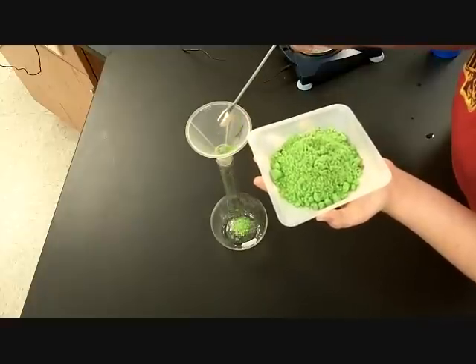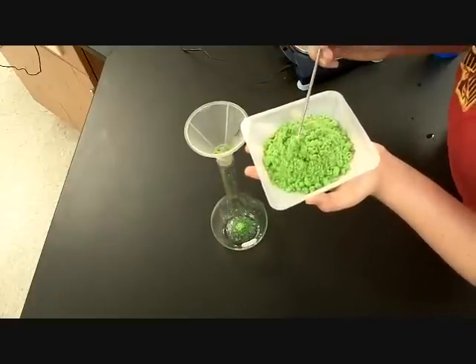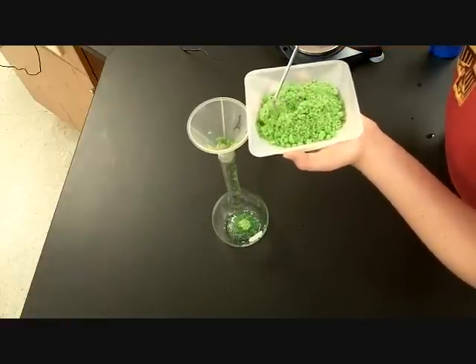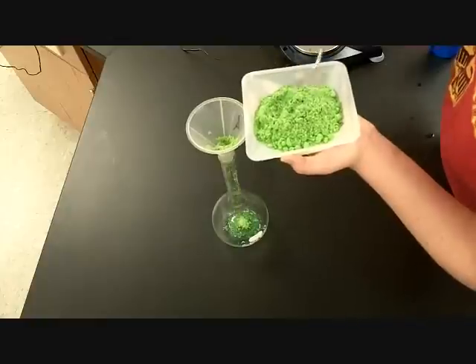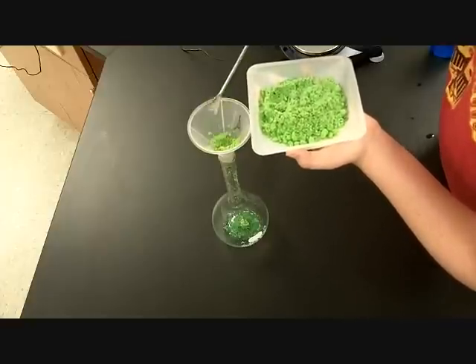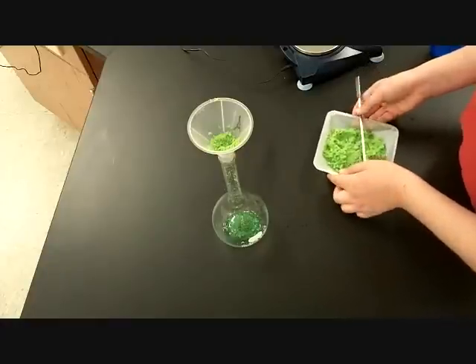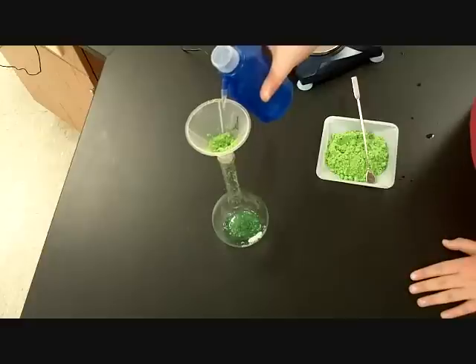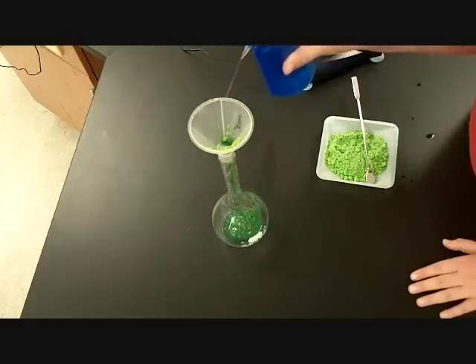Carefully. Okay, drop it. Oh, good. Keep going. Get in as much as you can. And if we need to, we'll place some distilled water in there to help get it in. Just take your time here. Good. Okay, go ahead and put that down for a moment. Take the distilled water and rinse the inside off. There you go, squirt it all around. Make sure that it all goes down. Get it all off of there.